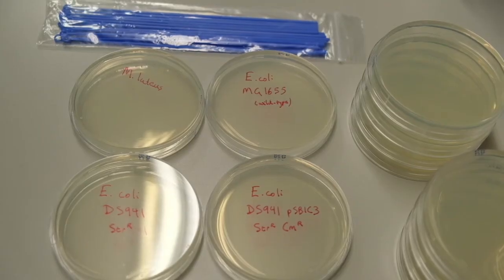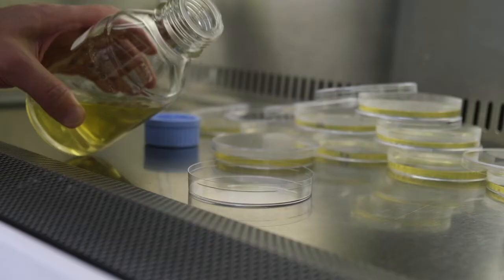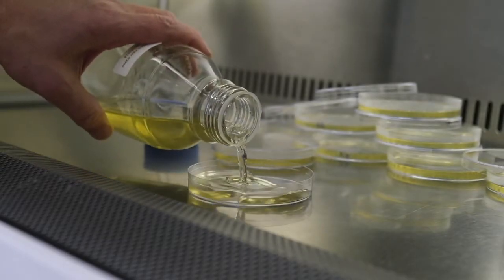You're going to be using a lot of plates in the laboratory. For instance, these nutrient agar plates for streaking your bacterial strains. So let's pour 16 nutrient agar plates.